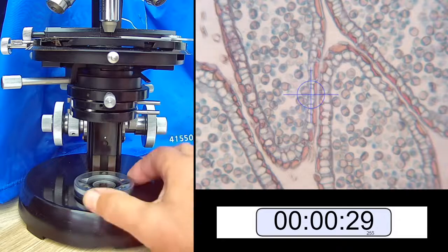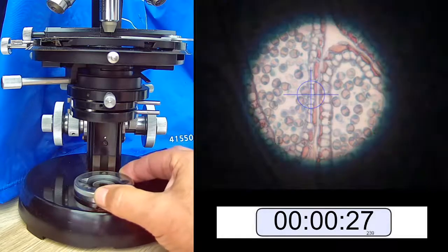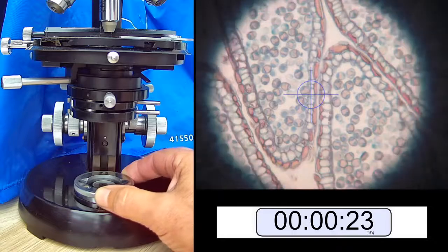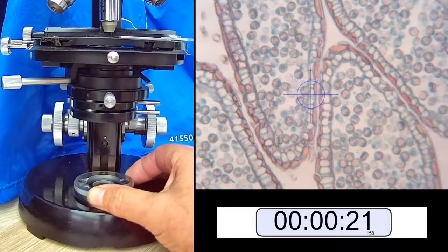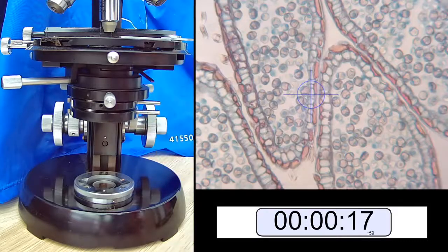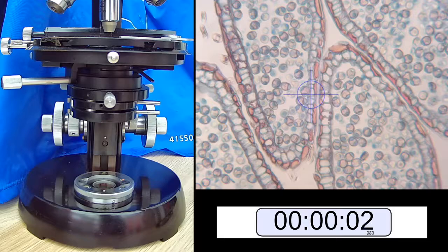So, quick recap: close field aperture, focus it using the condenser focusing, outside of field of view, adjust the condenser aperture. Now, the downside is you're going to have to do this for each objective when you change to another objective. The upside is you will have evenly illuminated, high resolution pictures that you can use for image analysis or any other purposes. So that's Köhler in a nutshell.